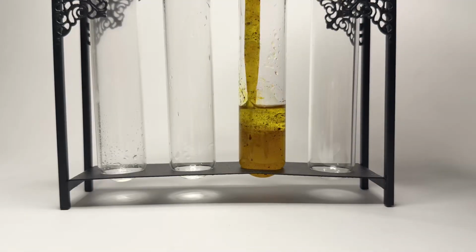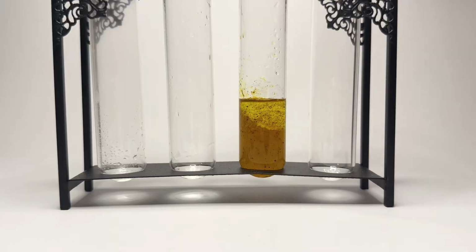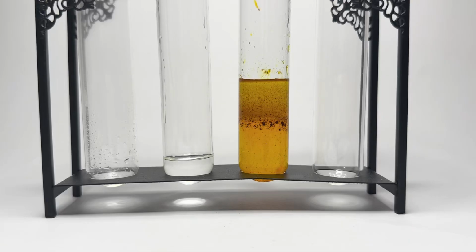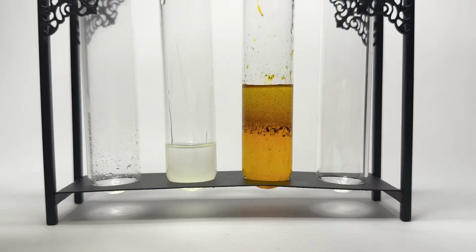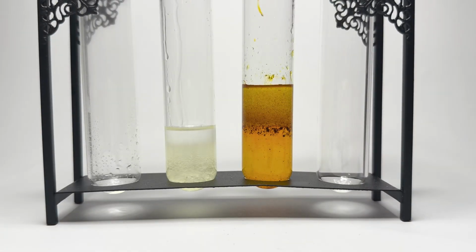Here I'm mixing around the oil and water layer to show that even when they're mixed up, they will ultimately separate back. And this is a common organic chemistry technique called extractions that you can do to get a molecule from one phase to the other phase and essentially isolate a compound. In this case, I'm not doing a separation of anything, but in a laboratory, you can use this technique to separate compounds in a mixture based on their polarity.